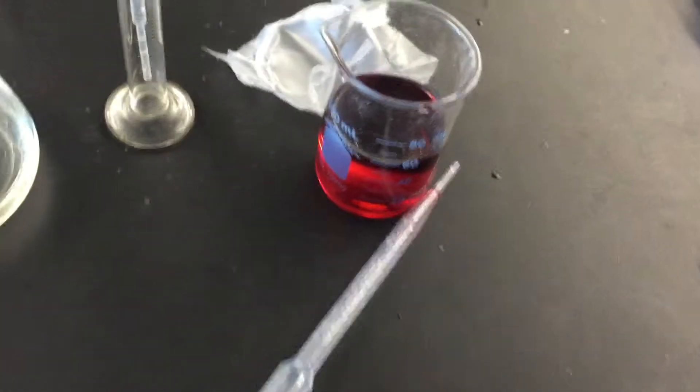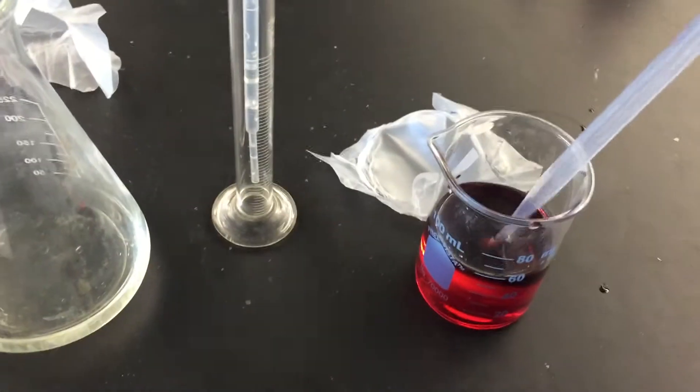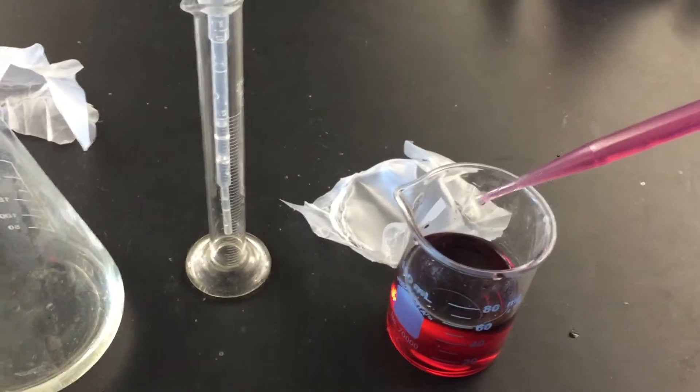What I have here is the cobalt complex that has that beautiful pink color. You can actually see it a little bit better here. What I'm going to do is put a little bit inside the bottom of a test tube.